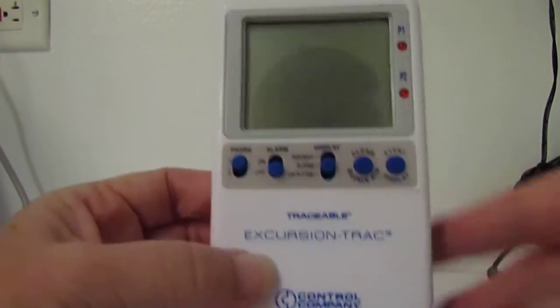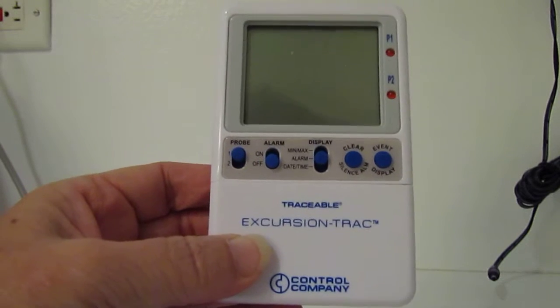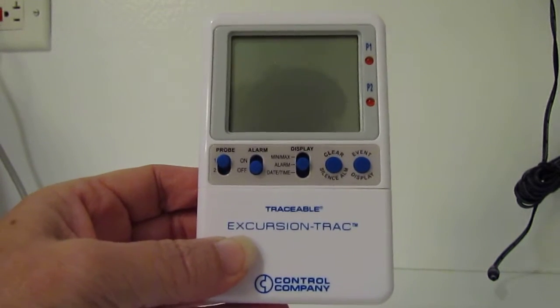This is a little video about your refrigerator thermometer.